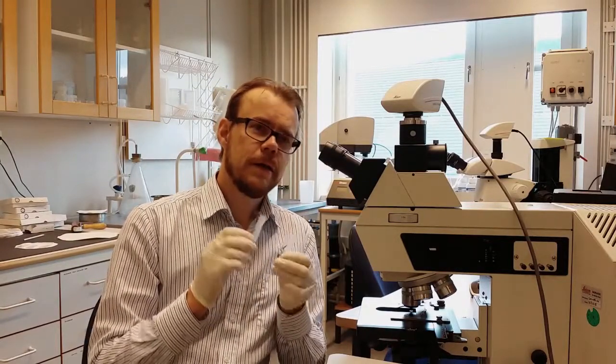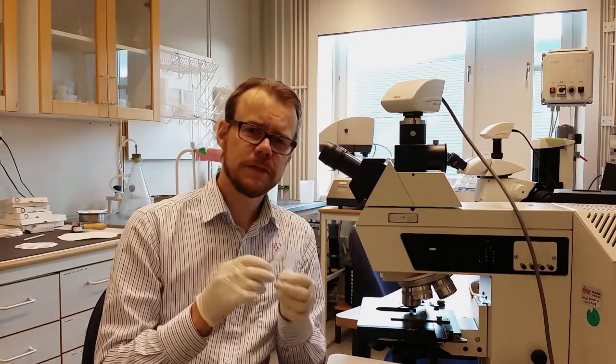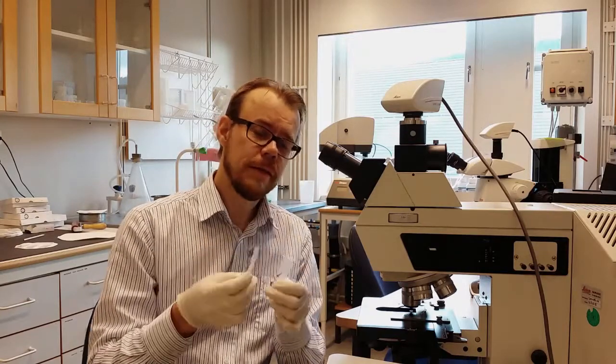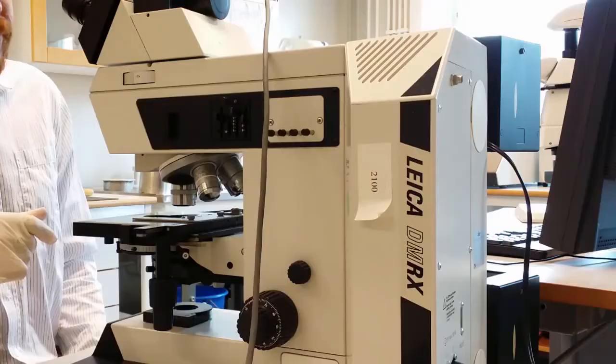So this is a paper where we have printed a silver nano ink on top, and we want to study the cross section of this print. And the first step is to do that with light microscopy. So here I have two samples to show that, and one of them I've used on this lambda contrast.